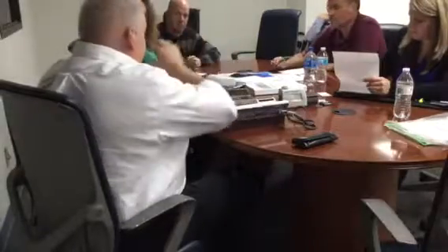Starting at 8, the auto range is opening itself up so the data will fit into the window. So that's all good. We're going to say okay. Nothing else to look at. You've got the auto return, make sure that's turned on. All right, and say okay, or exit.